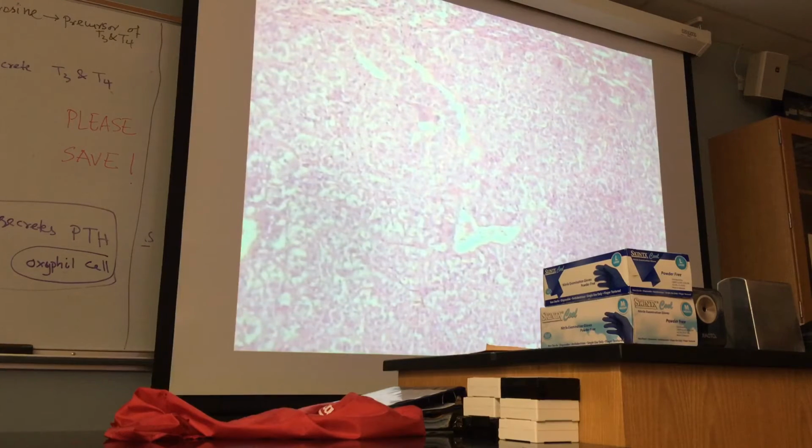Chromaffin cells make the hormones collectively called catecholamines. And catecholamines include epinephrine and norepinephrine. What is the other name for epinephrine? Adrenaline. From where does the gland get its name? Adrenal glands. Adrenaline. But where from? From the adrenal medulla. Adrenal medulla secretes adrenaline and noradrenaline. Adrenaline now is known as epinephrine. And noradrenaline is norepinephrine or NE. And the cells are chromaffin cells.